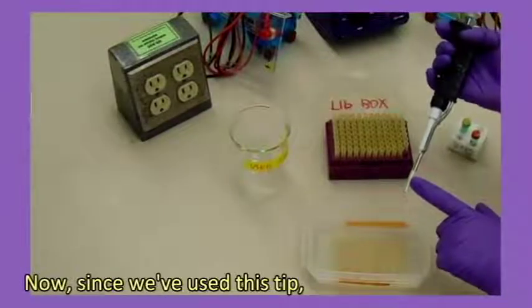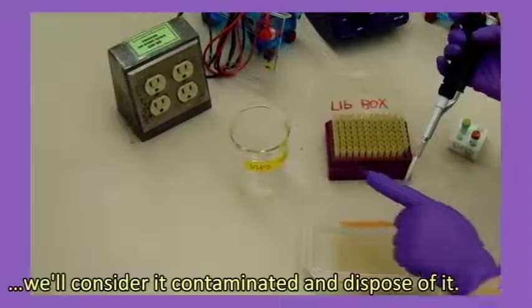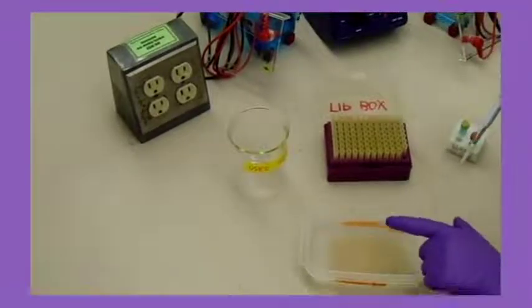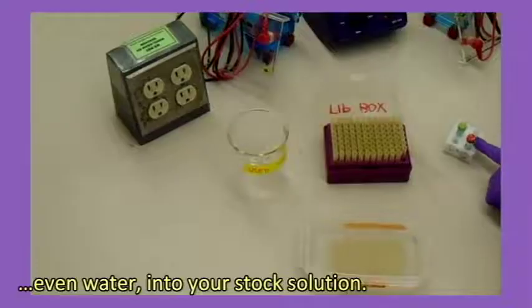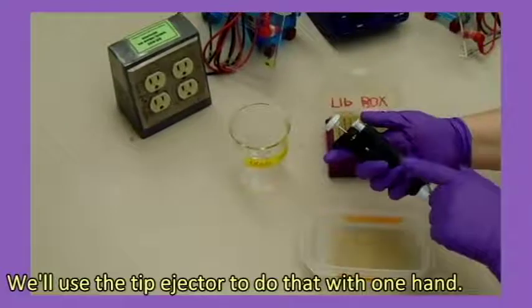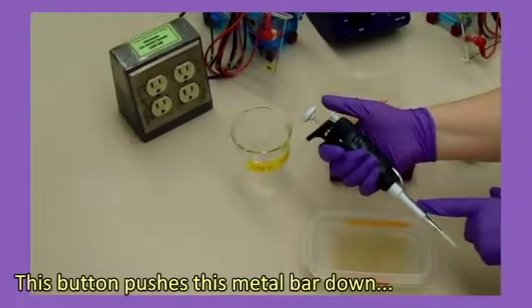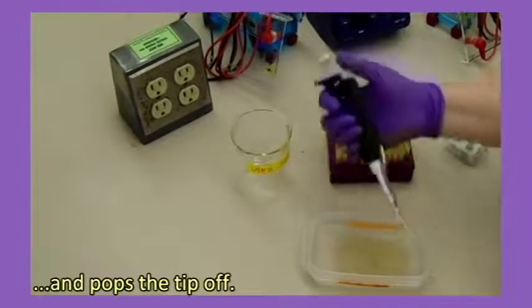Now, since we've used this tip, we'll consider it contaminated and dispose of it. You never want to introduce a foreign substance, even water, into your stock solution. We'll use the tip ejector to do that with one hand. This button pushes the metal bar down and pops the tip off.